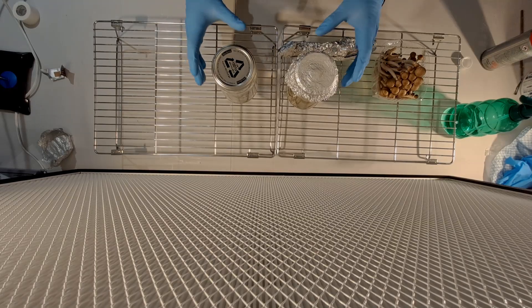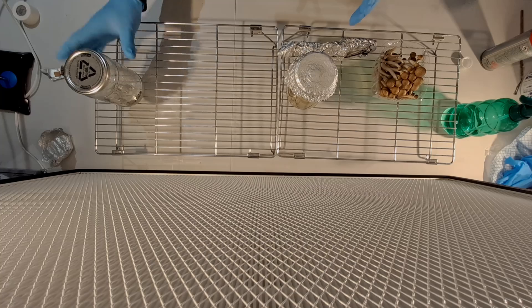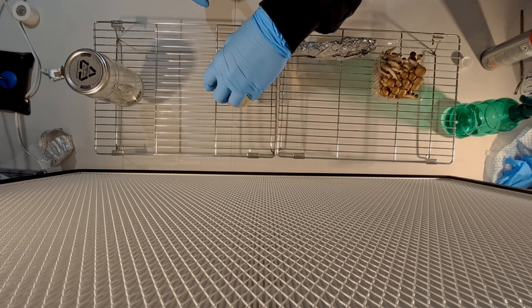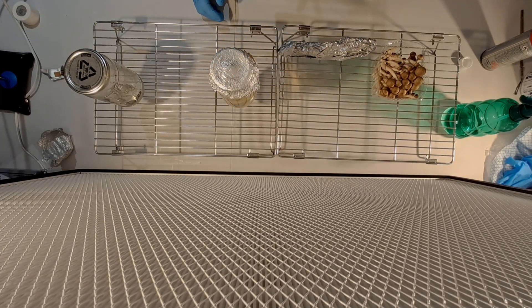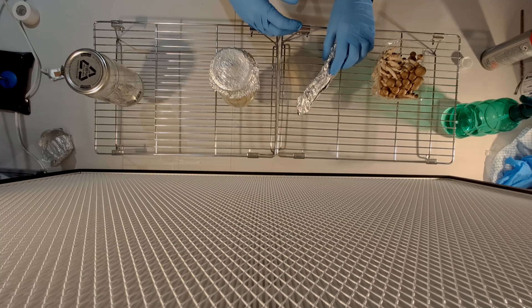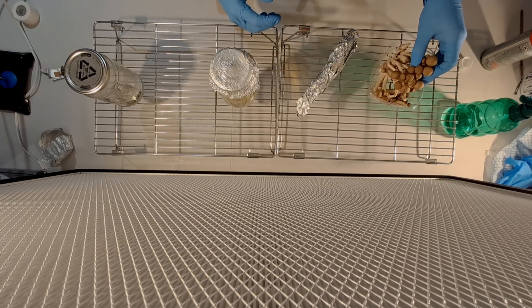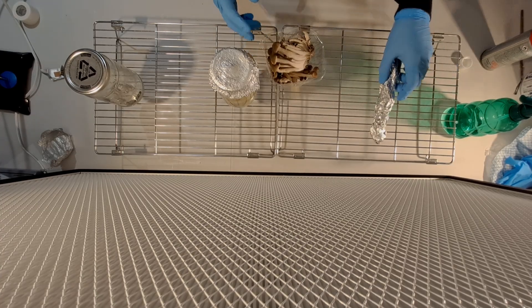Something I forgot to point out is you also want to prepare a batch of liquid culture to go in the pressure cooker at the same time as the other items. I've got plenty of videos already on how to make liquid culture so I'm not going to cover that in this video.